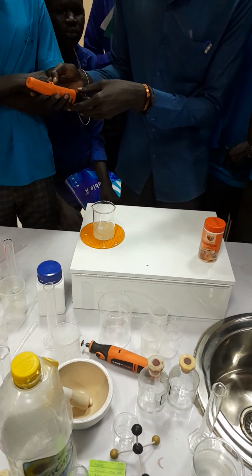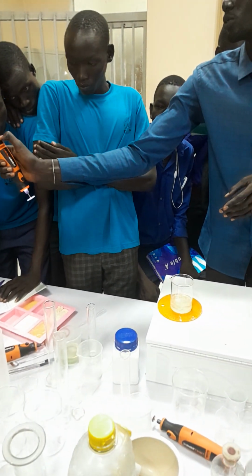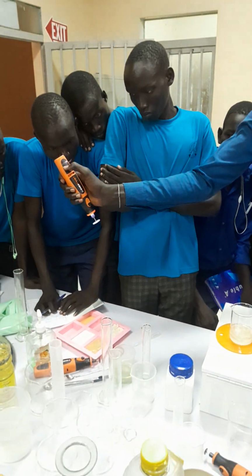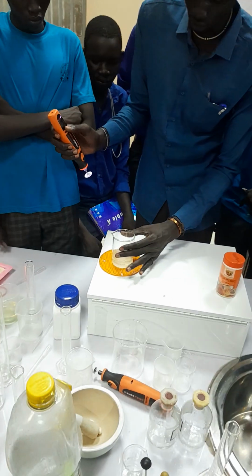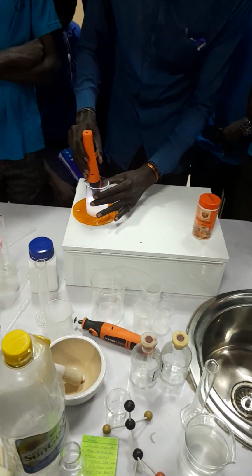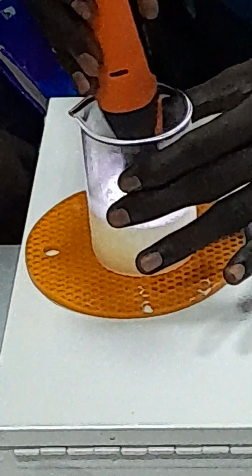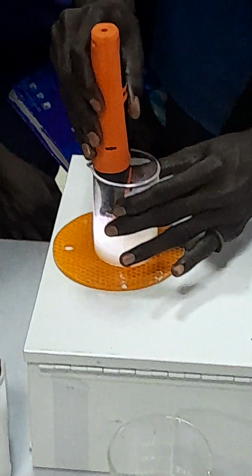And then now, you open the device, it is here. You open like this, you see? If you want to reduce, you reduce with the negative. If you want to speed up, you do it like this. Then now you hold this. Then you just start it like this, for the mixture. Mixer. Are you seeing it? Yeah. Very clear.